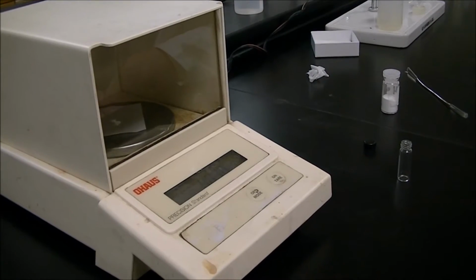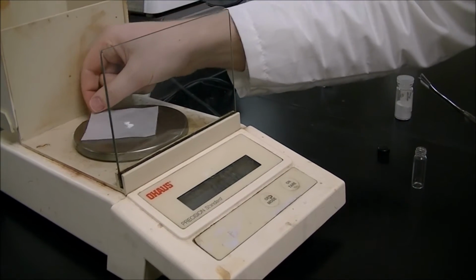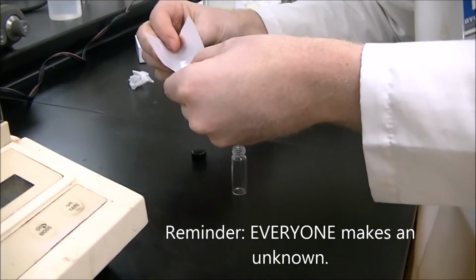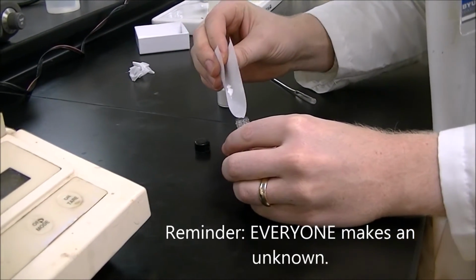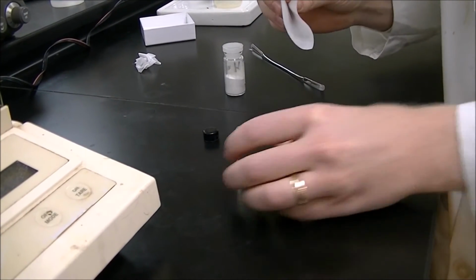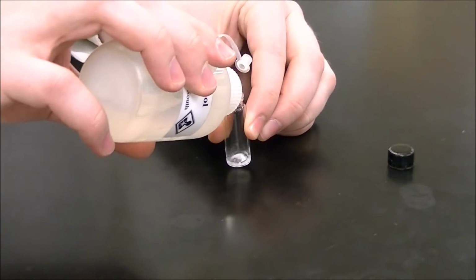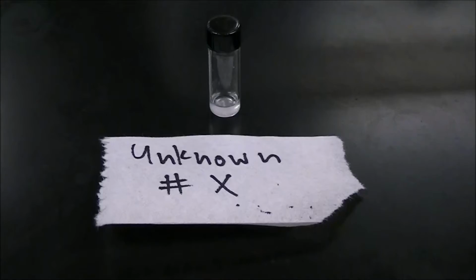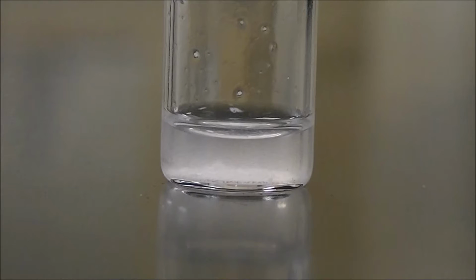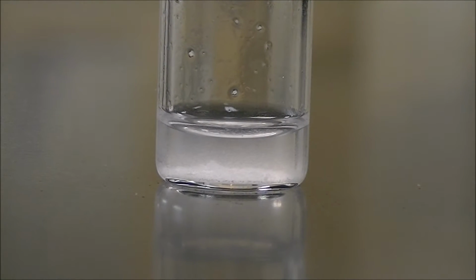Like we did with the known compounds, you're going to weigh out 10 milligrams of your unknown compound and place it into a screw cap vial. Add a few drops of methanol to your unknown. Place your unknown next to its label and add your capillary spotter. In each of the vials you make, there's going to be some undissolved solid, and that's okay.